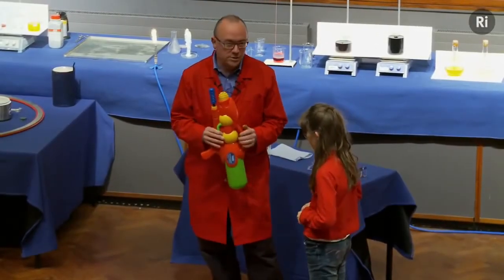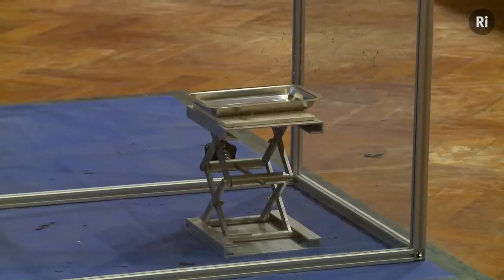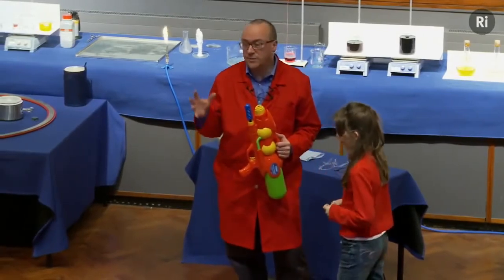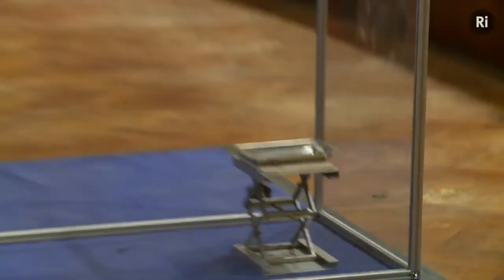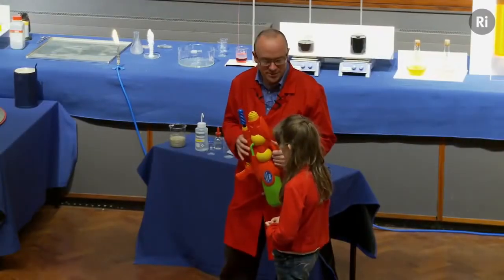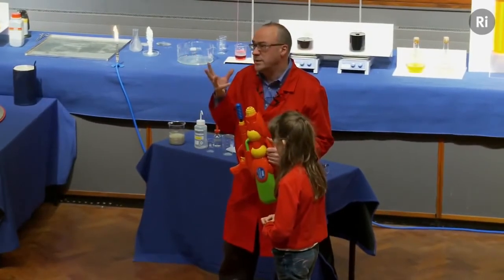All right. And what you're going to do is to squirt the water pistol at a little metal dish. Can you see that on the little stand there? And that dish contains a mixture of silver nitrate and finely powdered magnesium. And if you can get a little bit of water to land on it, we'll see if that can start a fire. Now, because this contains magnesium, it's going to produce a very bright light.